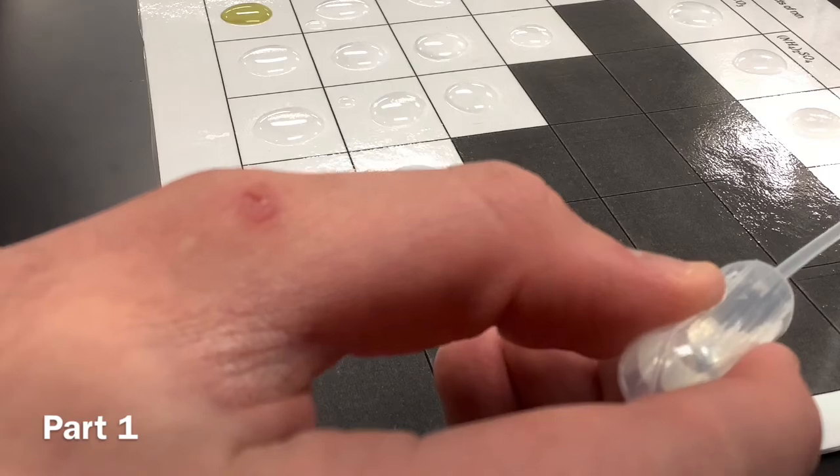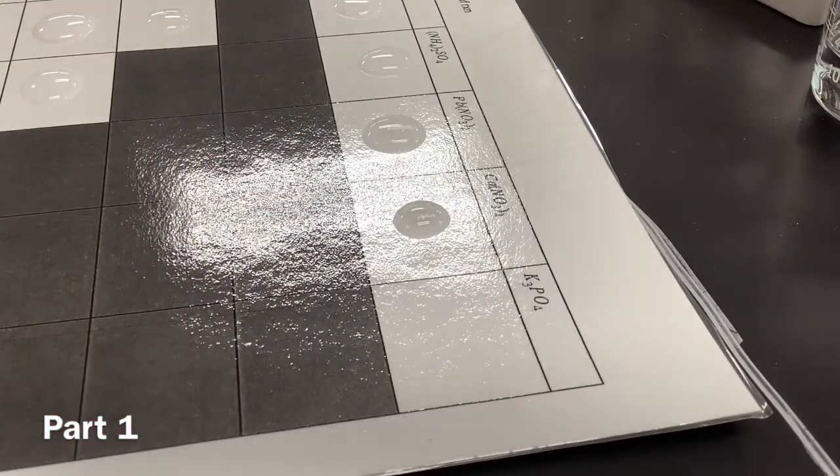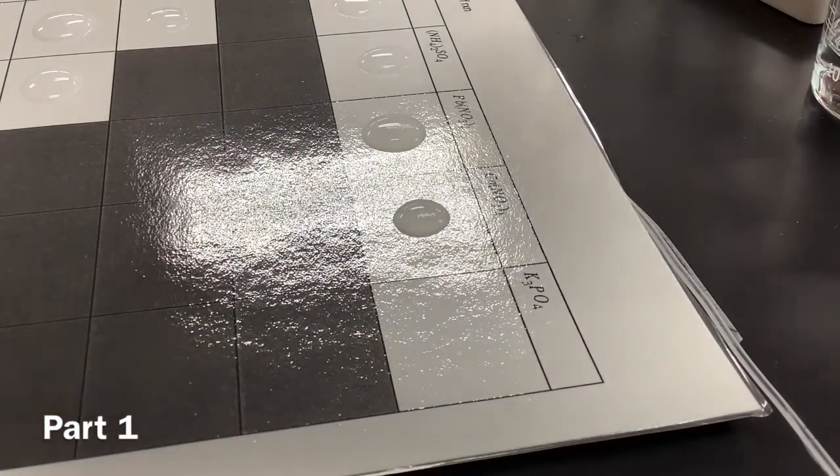You heard it here first, folks. That was Miso saying it's a great cloud. Oh wait, your hand is in the way. Nobody wants to see your hand. I'm sorry. Look, so Ca(NO3)2, and then we're mixing that with barium chloride.